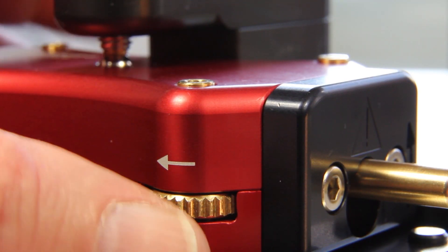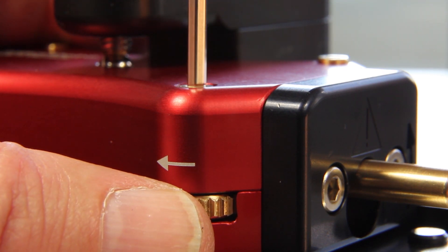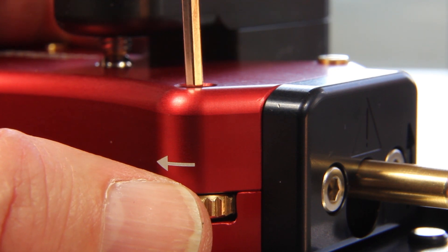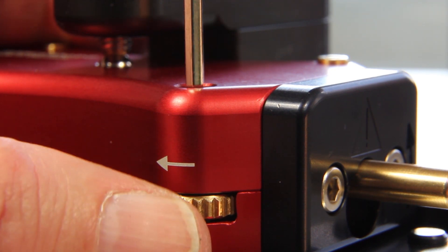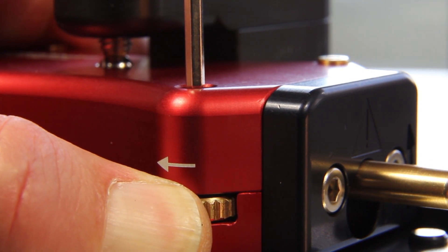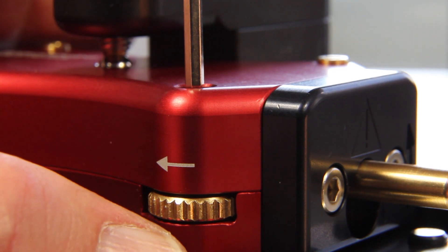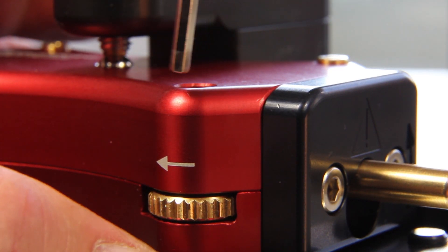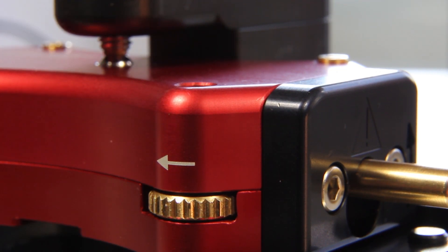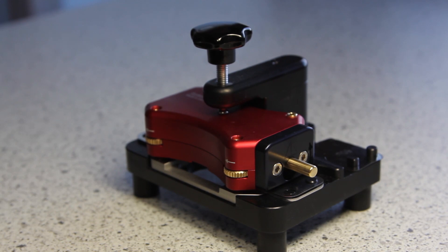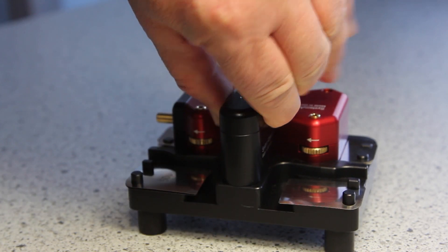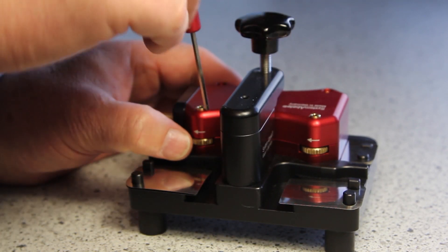I do the same with all four feet. I move the counter nut, the same time I turn down the foot. And when I am down I counter the counter nut. Now the foot is firmly on the bottom. I turn around the setting device and I do the same on the other side.